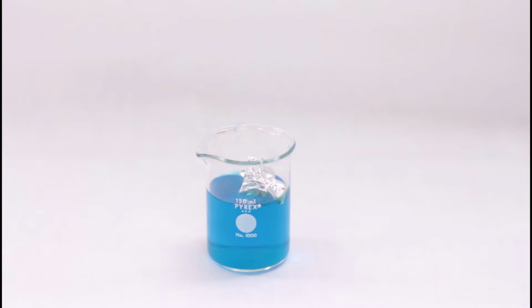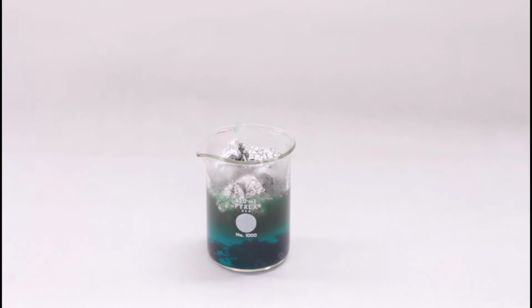In this lab, we will be visualizing a basic redox reaction by predicting the reactivity of metals in solutions based on their reduction potentials. So this will be a qualitative analysis. We will be setting up microwells, which provide a convenient method of testing a variety of chemicals at once. These could be easily used to test the reactivity of a metal to ascertain its identity, or test the identity of a compound through a series of precipitation reactions.